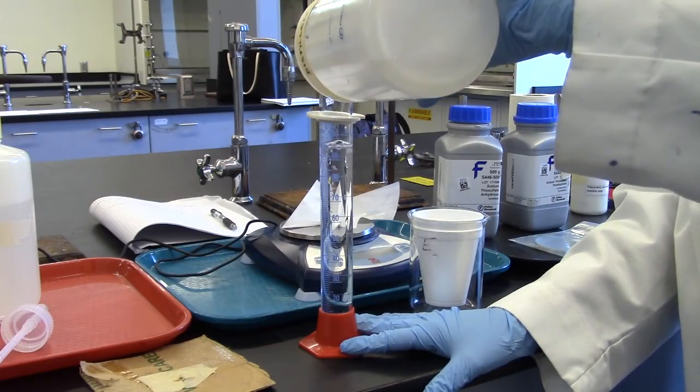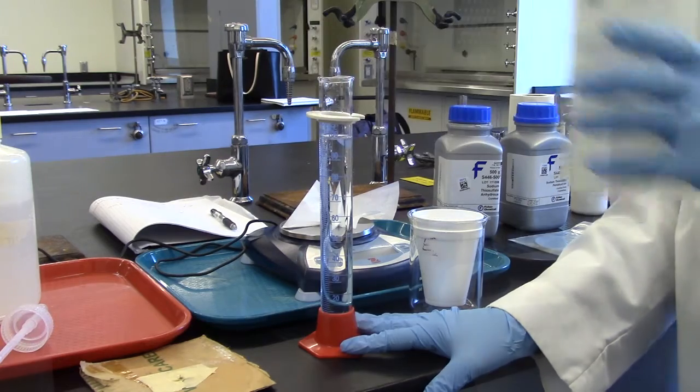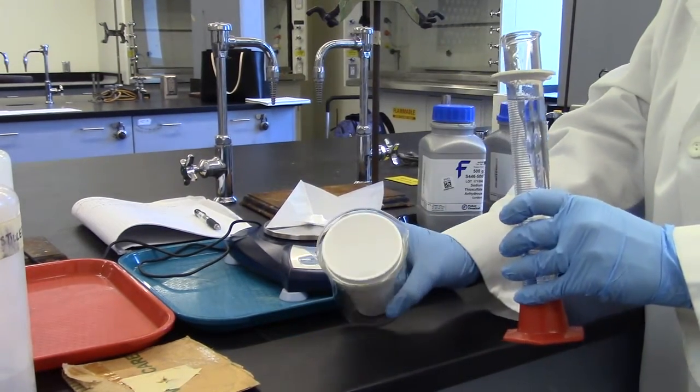Measure 100 milliliters of distilled water. Transfer to the calorimeter.